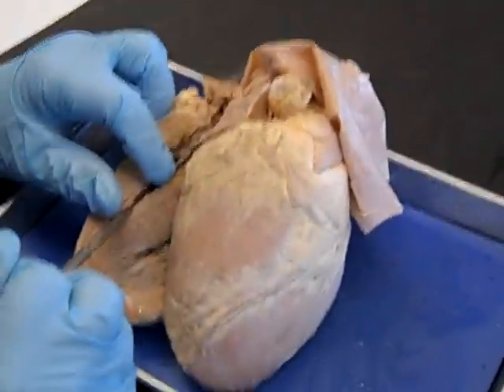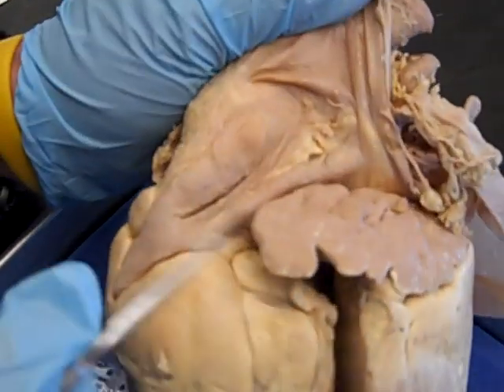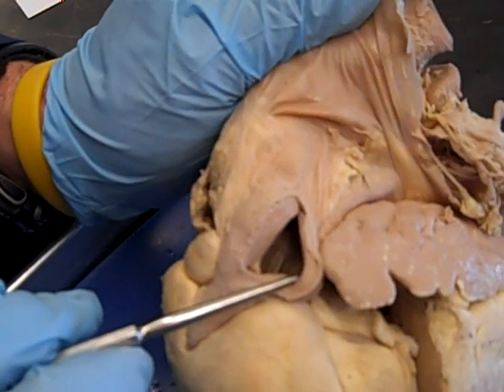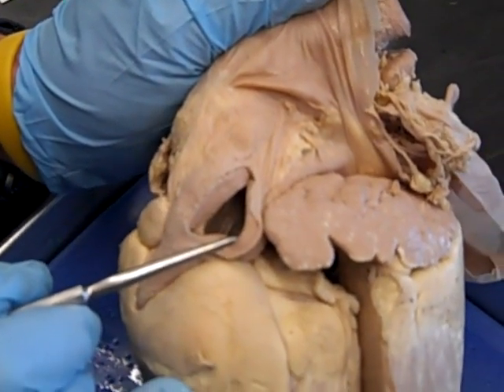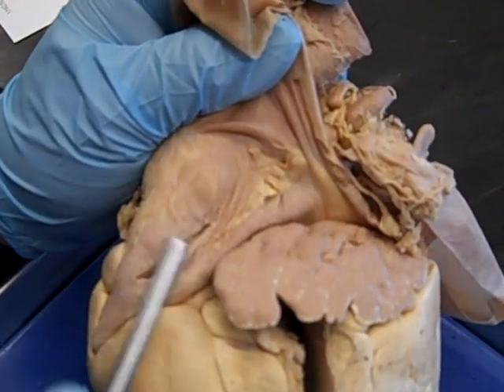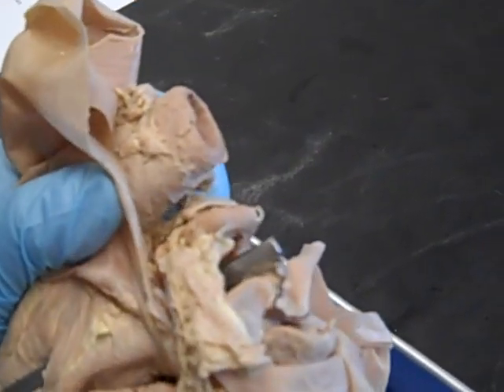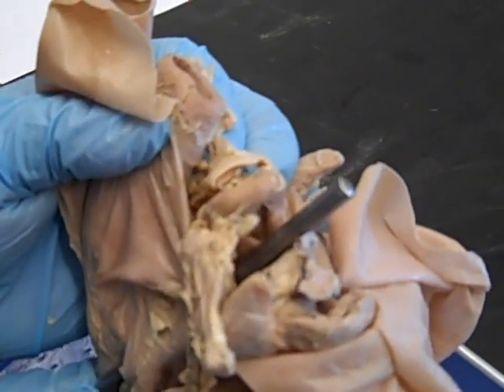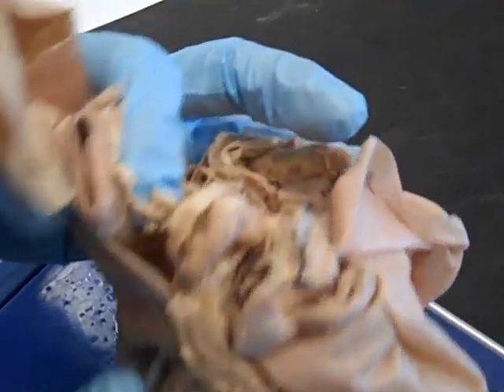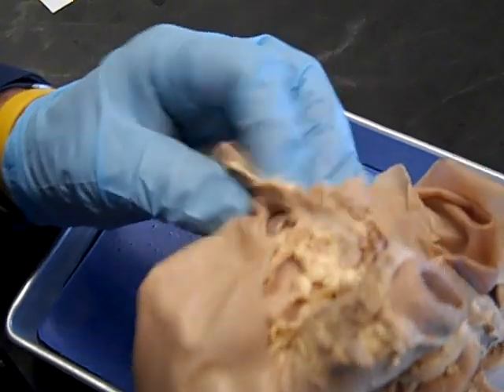Blood leaves the right ventricle and goes out through the pulmonary trunk. The pulmonary trunk is an artery — you can see it right here. You can tell it's an artery because it has thick walls; arteries have to accommodate greater pressure than veins and need thicker walls so they don't rupture. If we push a probe through — always use the blunt end so you don't make new holes — there's a hole going toward the left side, which is the left pulmonary artery, and one going toward the right, which is the right pulmonary artery.